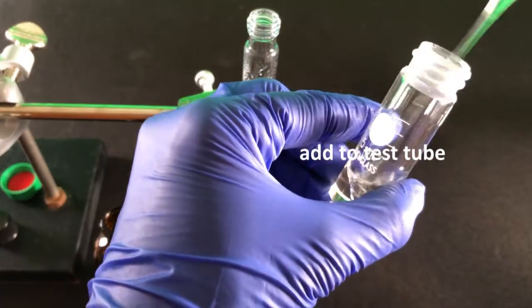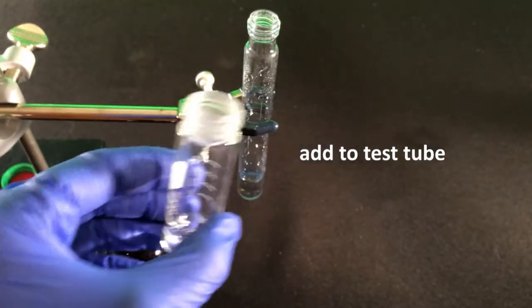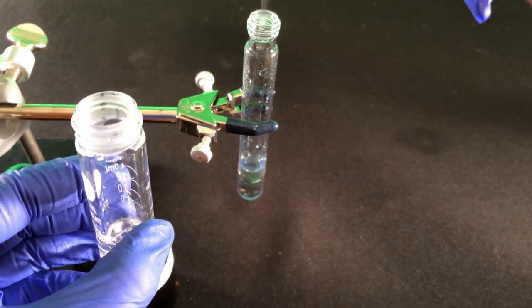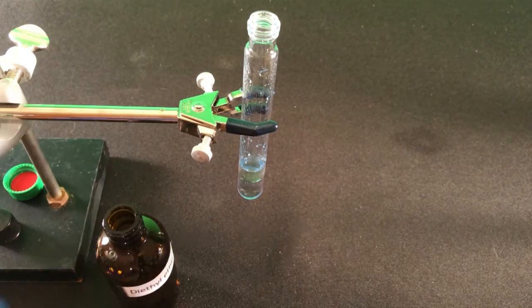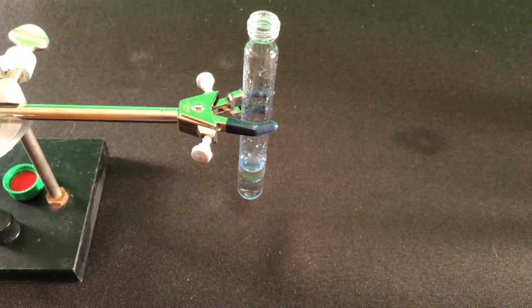You will need to mix the two solvents very well, which will increase the contact surface area and cause the distribution of the compounds in the solvents. Compounds will seek out the solvent in which they are more soluble. So we're extracting the product out of the aqueous layer and into the organic layer.